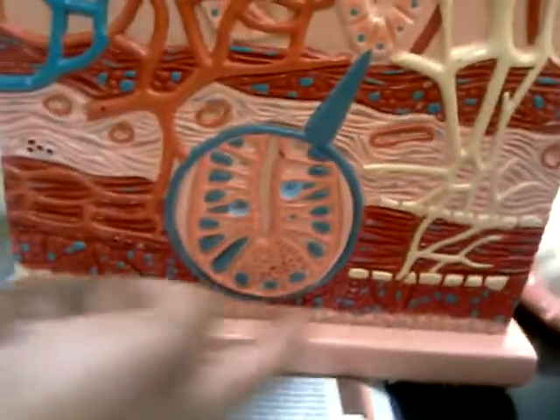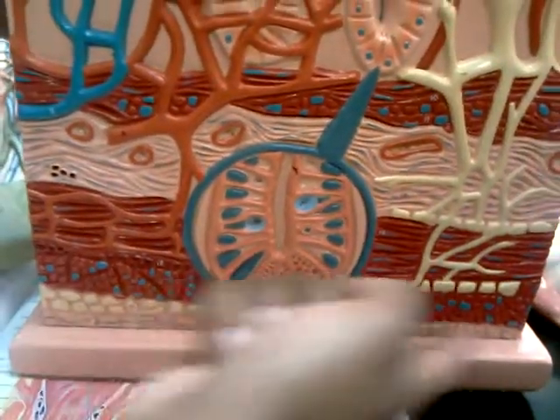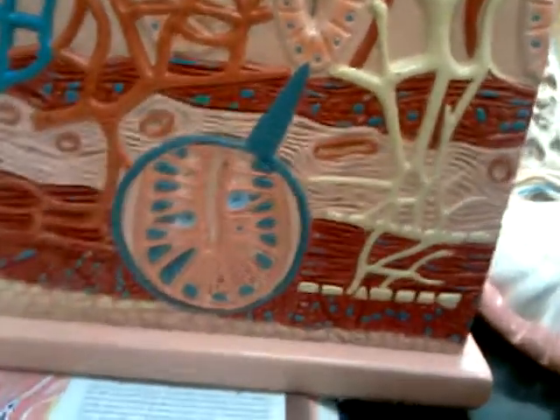And then this last peach part on the bottom here would be your serosa, which is the outermost. Serosa slash adventitia — they're the same thing.